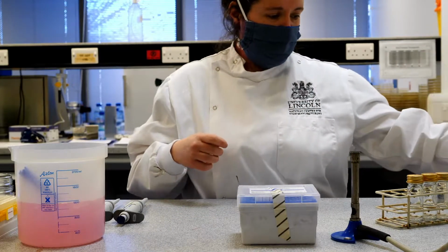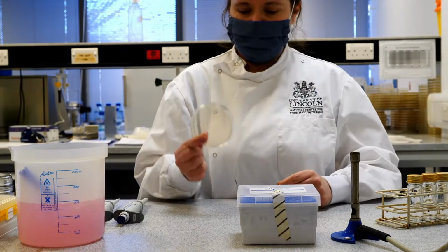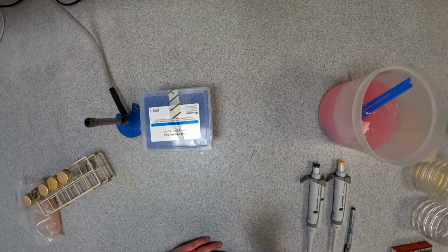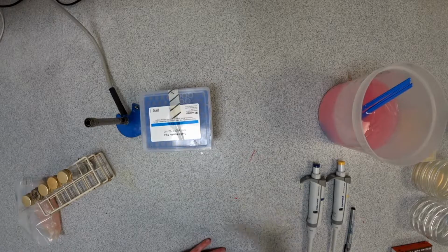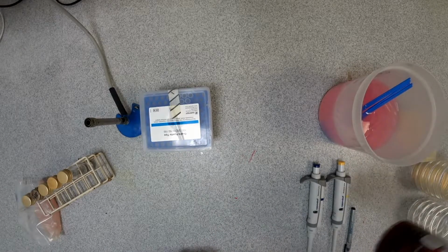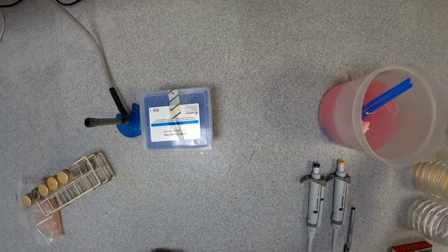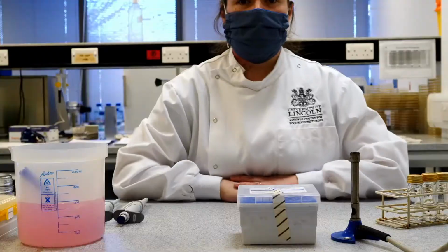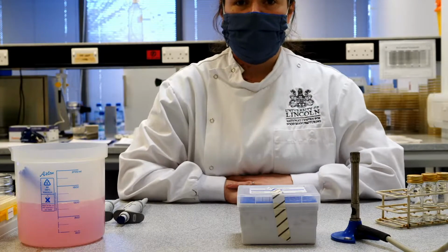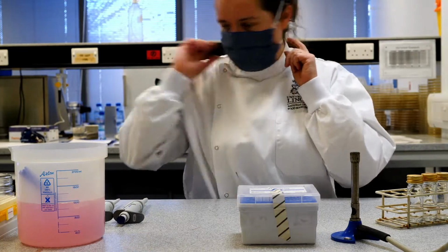The next step is we're going to do some spread plating onto a nutrient agar, and this will allow us to see the types of organisms that will grow just on a good general growth medium. So this is looking for the bacteria within the sample. And then we're also going to carry out some pour plating using VRBGA agar, and that will allow us to look for the presence of Enterobacteriaceae in our sample, which are a really common indicator of fecal contamination within our product. So let's get started.